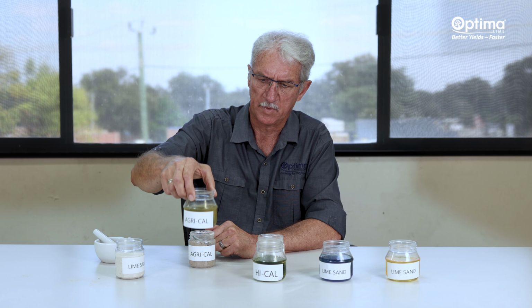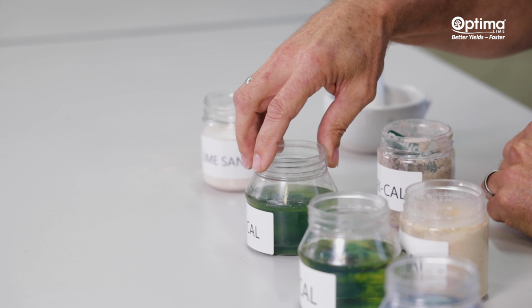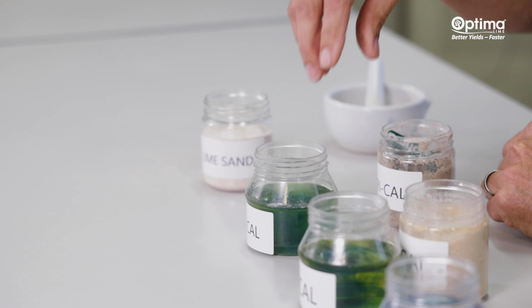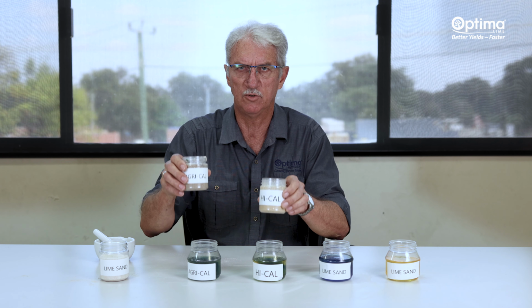It's got a higher pH than just calcium carbonate as well, so there's a quicker reaction from that perspective. The pH value of lime sand, calcium carbonate, sits about 8.5, 8.7, around there. The reagents in here have got a fair loading of calcium hydroxide, so your pHs are very different in these two products.